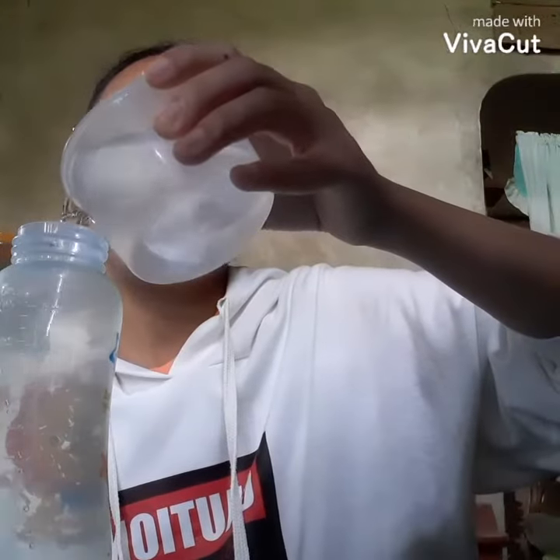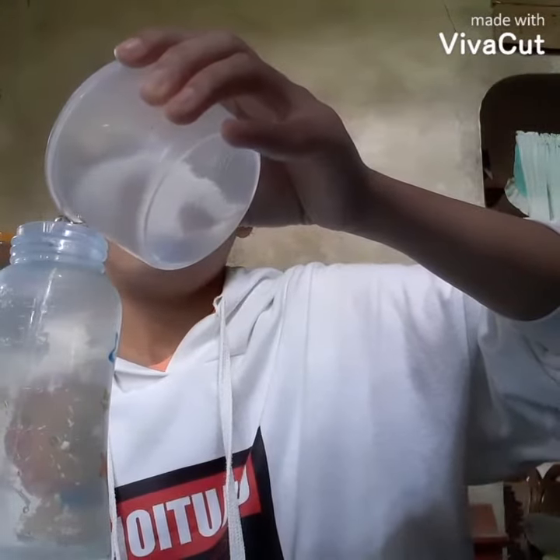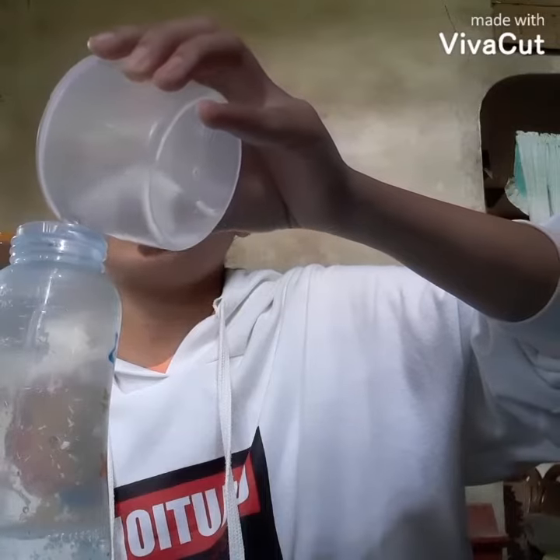When water is placed into a container, it takes on a curved shape known as the meniscus. These devices are calibrated so that when viewed at eye level, the bottom of the meniscus will give the most precise result. It is important to properly read the meniscus at eye level and be precise when measuring in order to accurately find the volume.